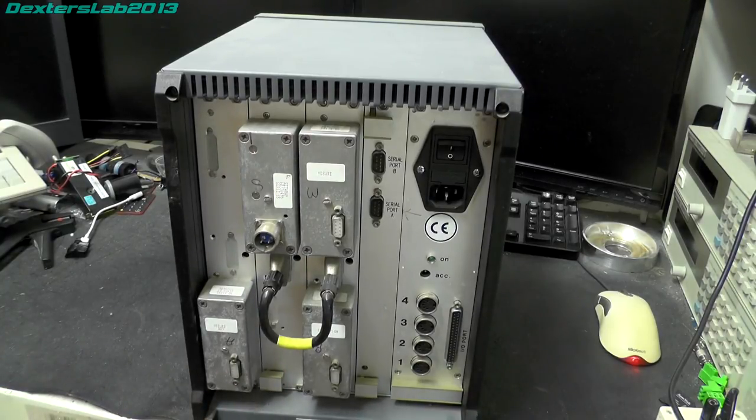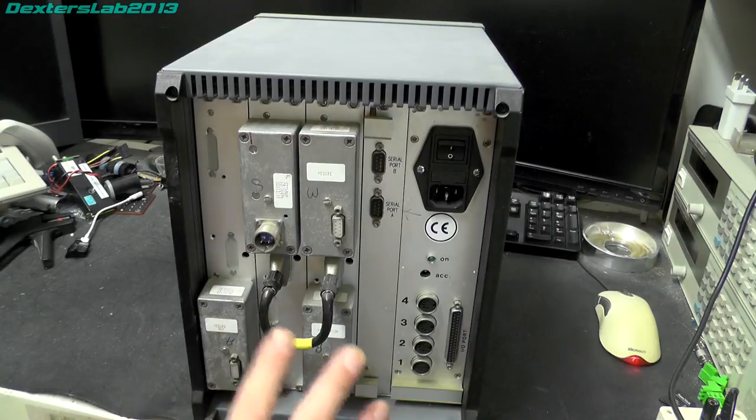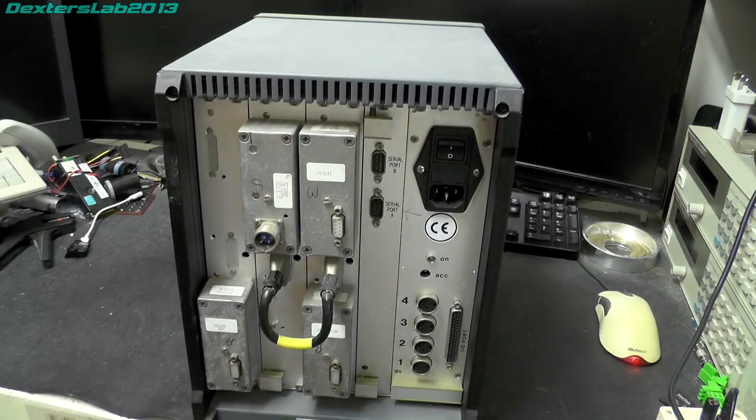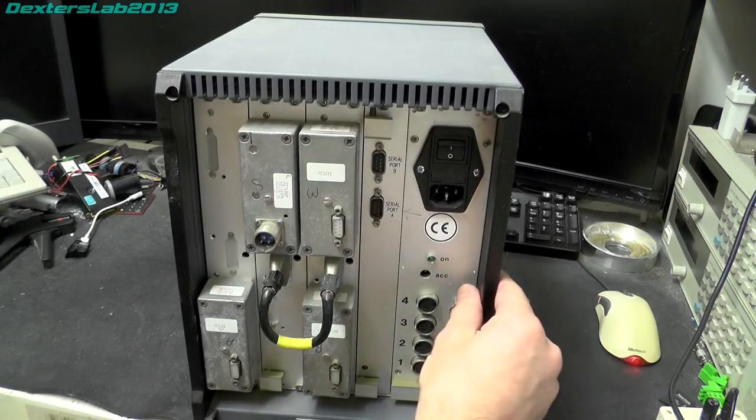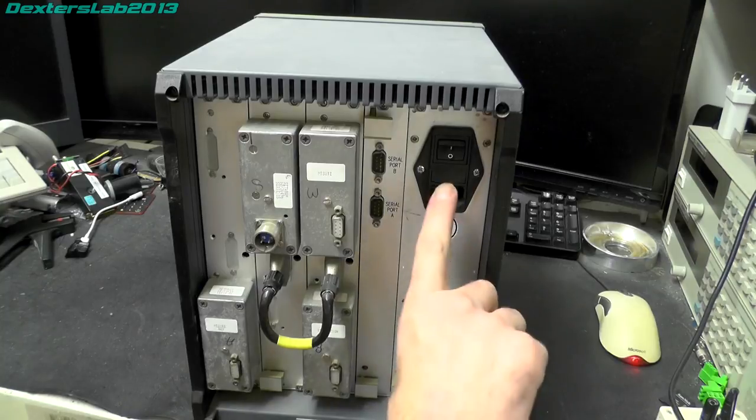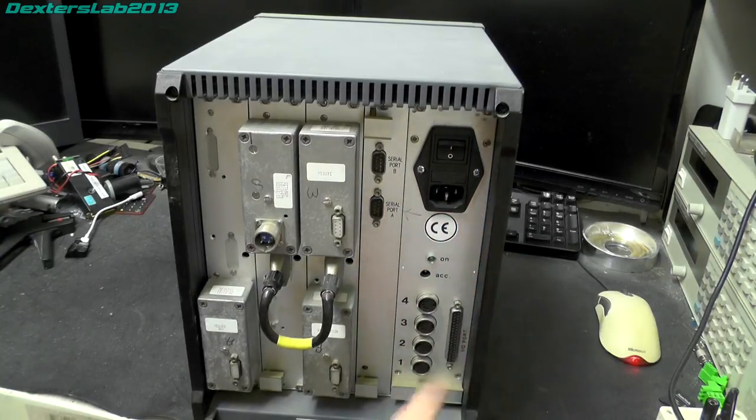First look at this, there's probably going to be a card frame. So these look like plug-in modules. And indeed, looking at other pictures on the internet of this unit, I've seen different options plugged in here. So there must have been interchangeable stuff depending on what you were trying to do. So in this end slot, we've got power supply input, standard IEC socket. We've got an on light, an accessory port, and four DIN sockets there, and an I/O port. So it looks like this is possibly the main part, which is probably the same on all of the units. There's probably a power supply on that board as well.